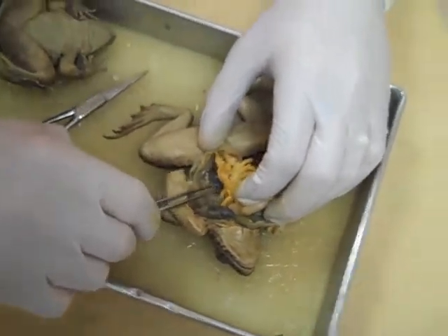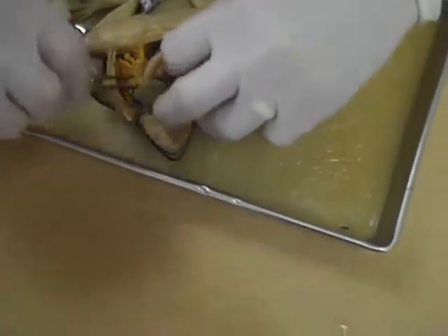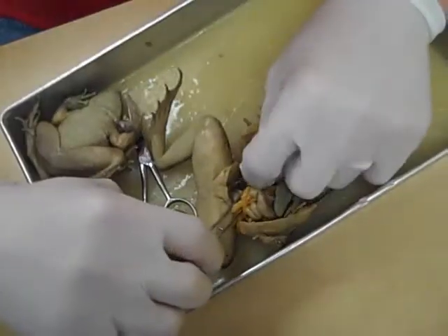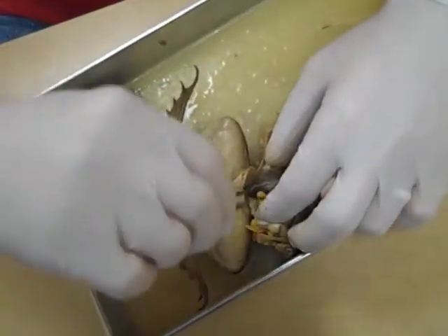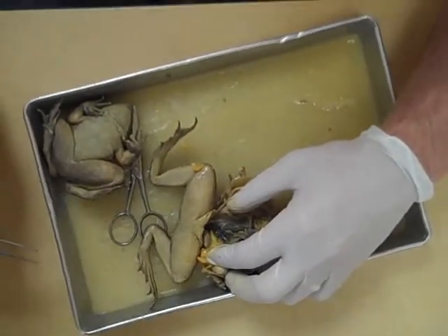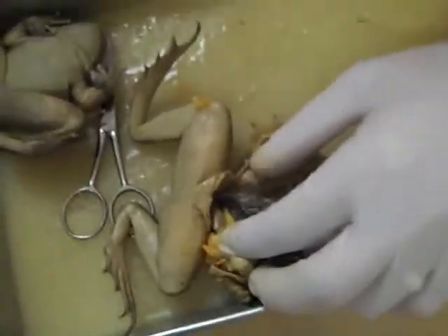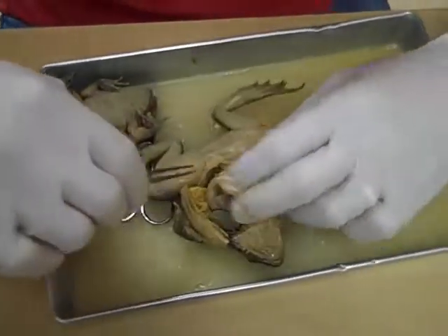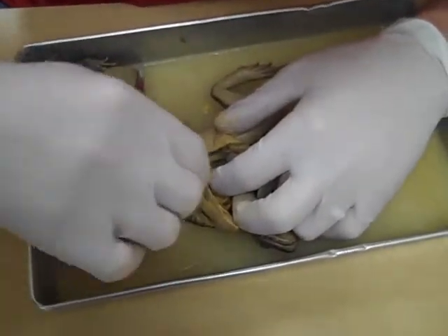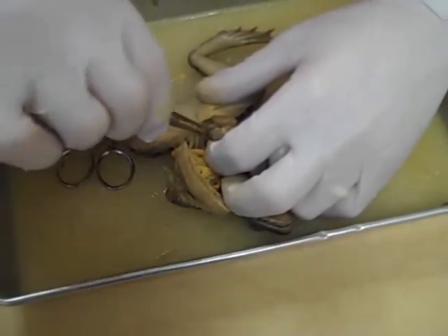Right here, this dark structure — we got one here and then one on the other side as well. Those are the kidneys — very large structures in the frog as well. Now in the last frog I did, the bladder was sitting right there, and there we have a bladder that can fill up and drain just like all bladders. So there's the bladder right in there.